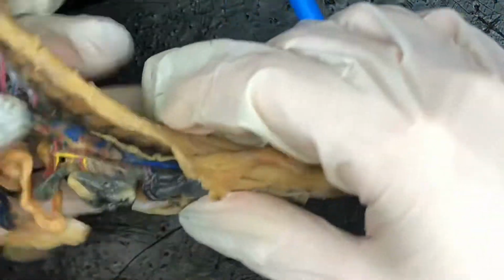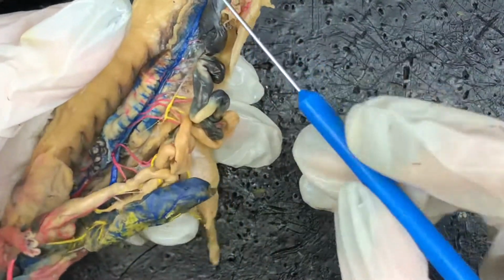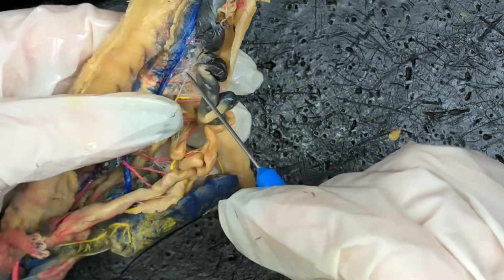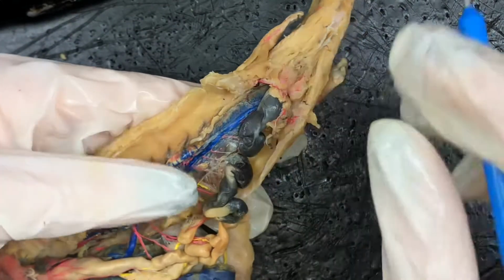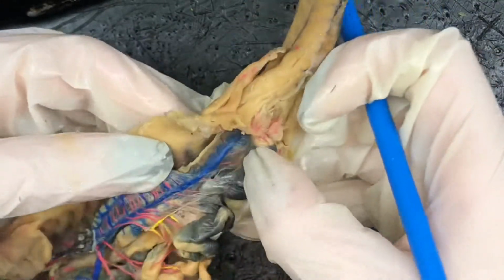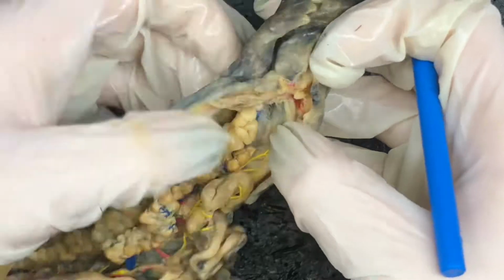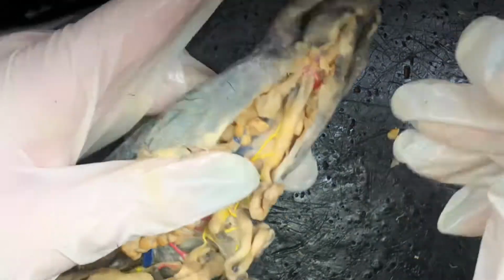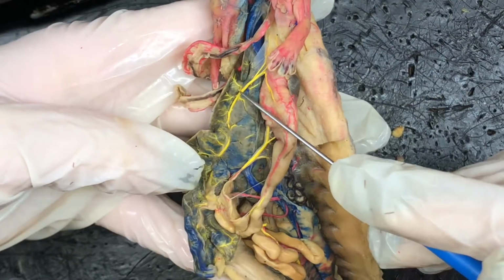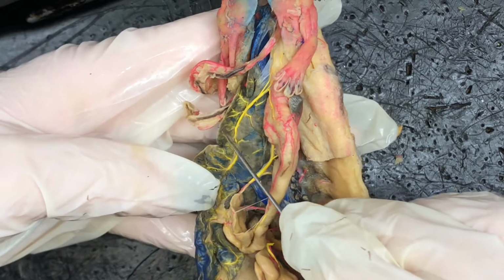We're going to switch back over to this one. The ventral abdominal vein is going to be running right through here. This would be the ventral abdominal vein as we get further down. And then we have the intestinal veins also, better seen in this female. The intestinal veins would be down here. We can see the intestinal veins running along the intestine right here. And then in the liver, we have the hepatic portal vein, which is this main vein right here that runs through it. And then the hepatic veins are the tiny veins that branch off of it.